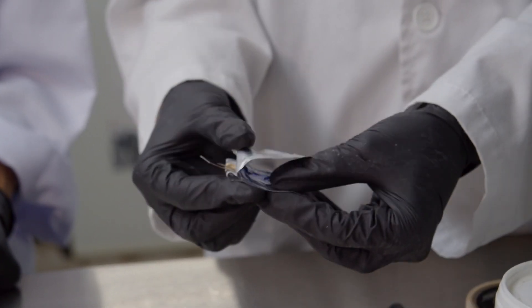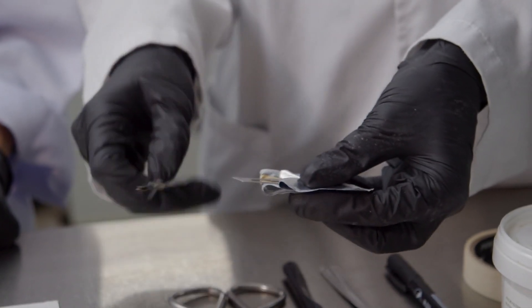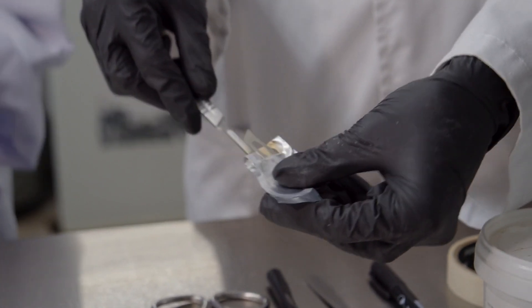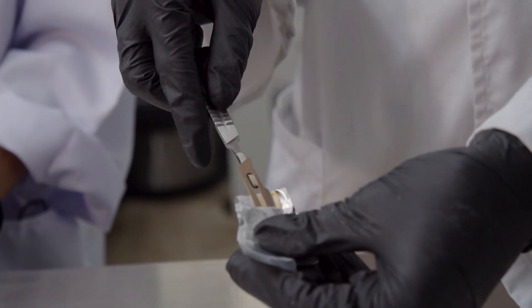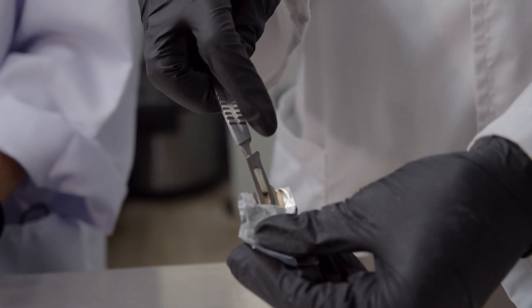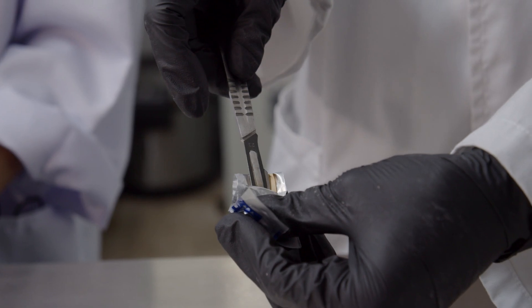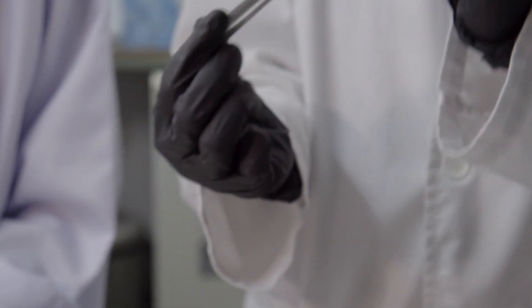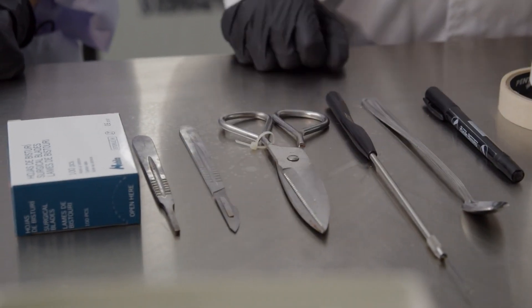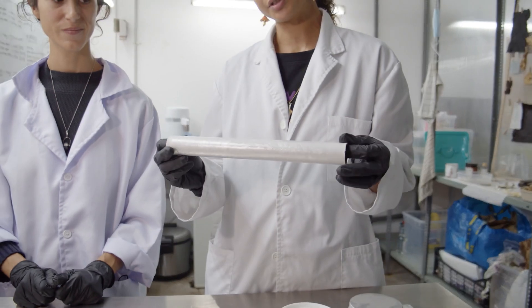Scissors for cutting aluminium, plastic, and tape. Scalpels with fresh blades — this is the proper use of a scalpel and how you insert a fresh blade. Make sure you get the right size, click it so both ends align at the same diagonal, and it should slot right in. If you keep it in the wrapper it's sterile, so as soon as you remove it, you no longer have a sterile blade.